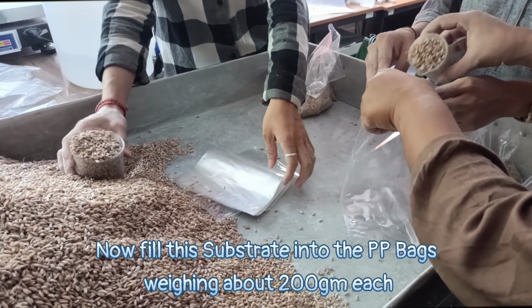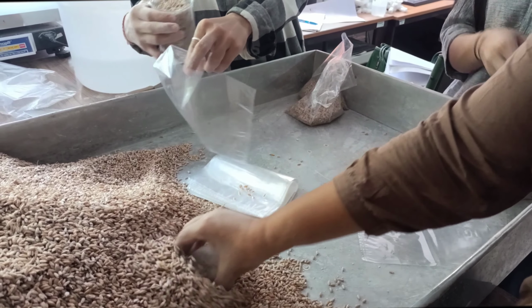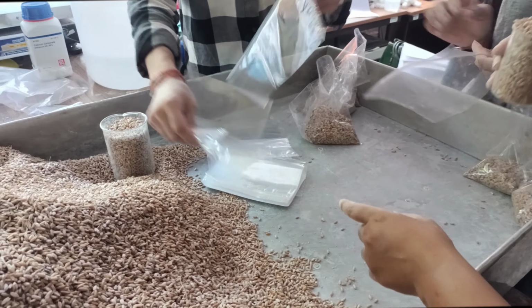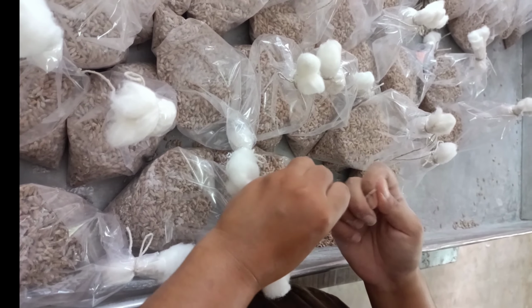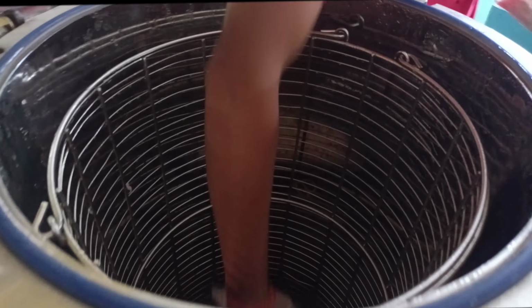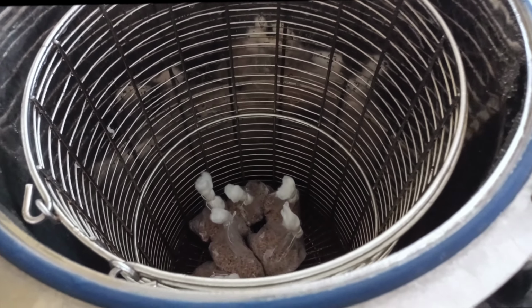Now we are filling the PP bag, each bag weighing about 200 gram. Now it's time to close the PP bag with non-absorbent cotton plug, and finally it's time for autoclaving. You can see, first of all, fill the autoclave with water and then put all the PP bags inside the autoclave.